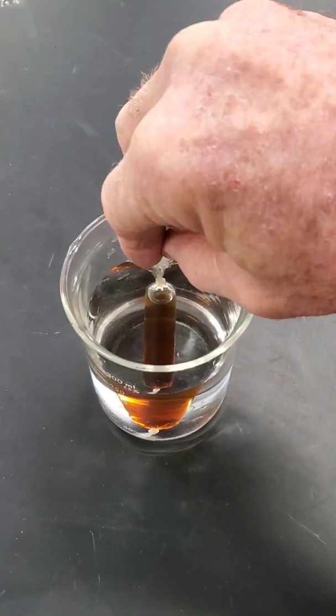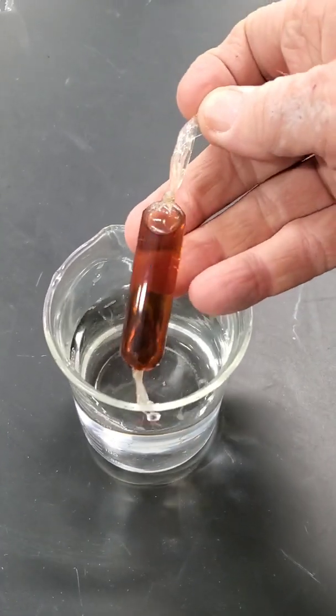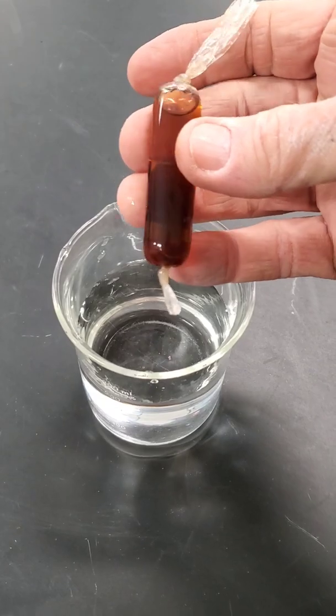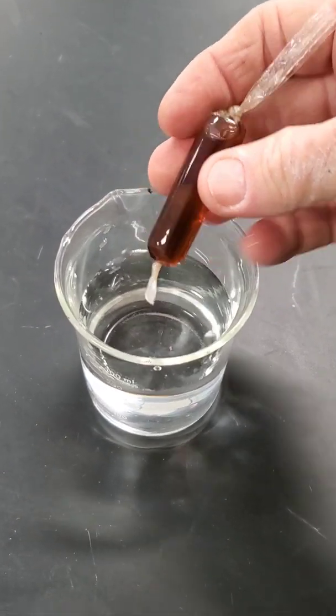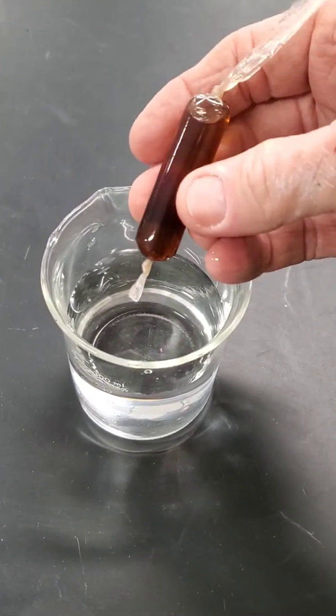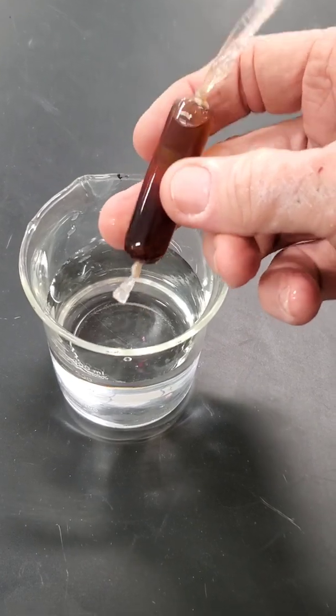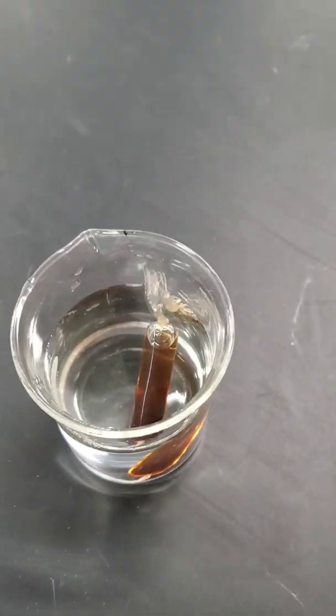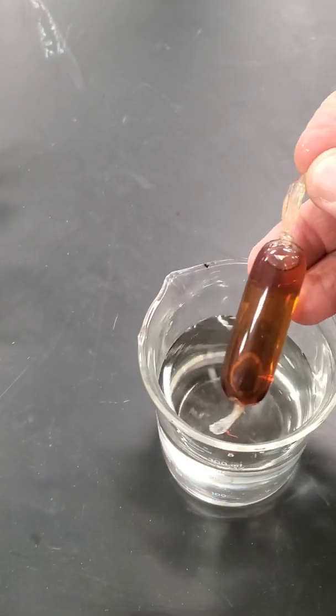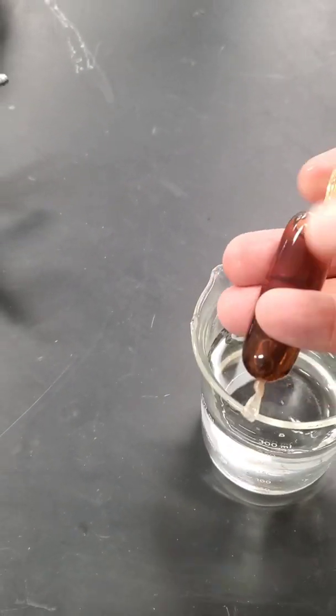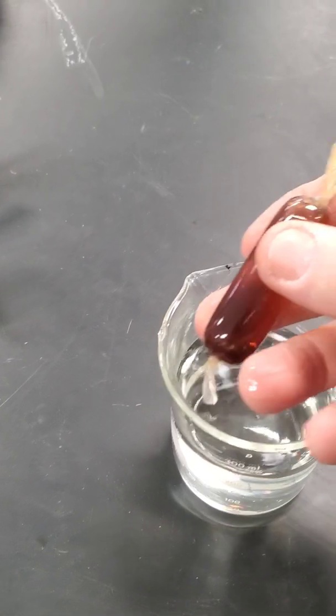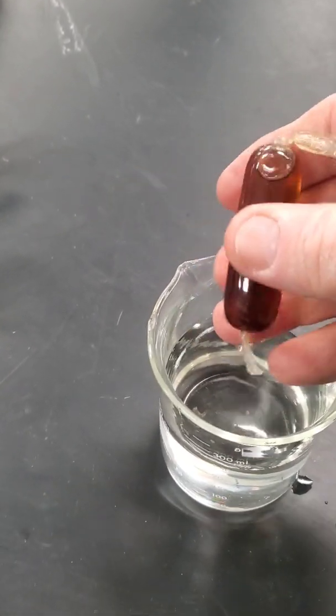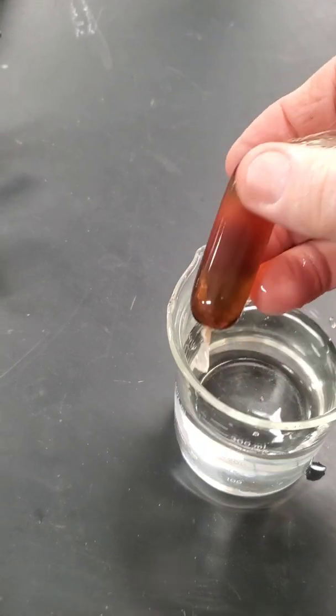Let's check our little bag. It looks a little different, it's kind of swollen up now. It's getting a little bigger, firm. It was not firm like this before. We'll leave it in the water for a while longer yet.